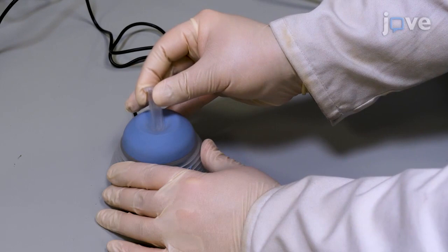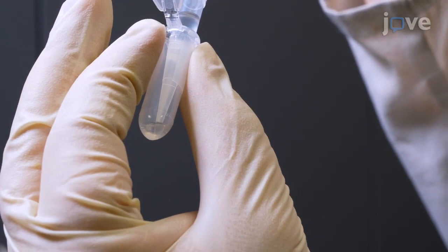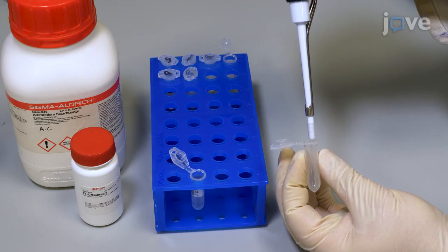Repeat the centrifugation step and discard the supernatant. Dissolve the pellet in 20 microliters of ABC buffer containing 10 millimolar dithiothreitol to reduce protein disulfide bonds. Incubate the solution for 30 minutes.